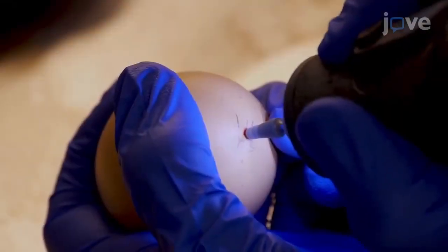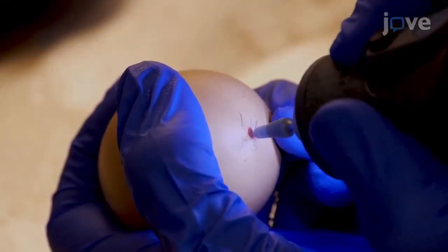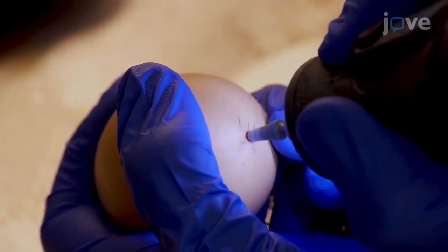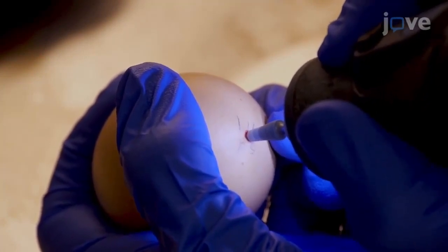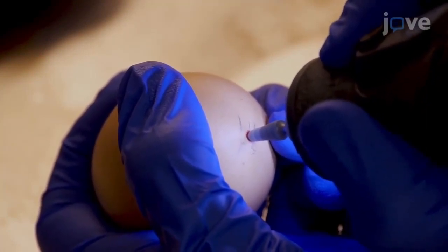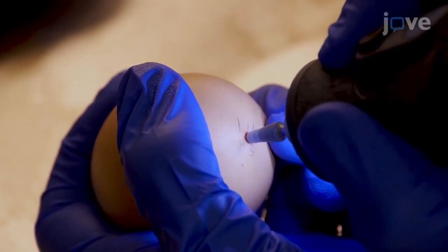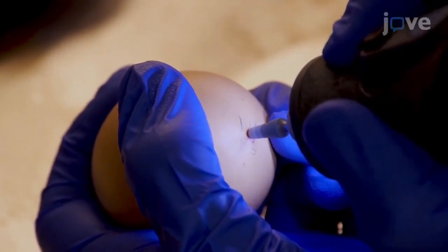After turning the light back on in the hood, use a cordless rotary tool fitted with a silicon carbide grinding stone to drill a small hole in the shell directly over the center of the air cell.